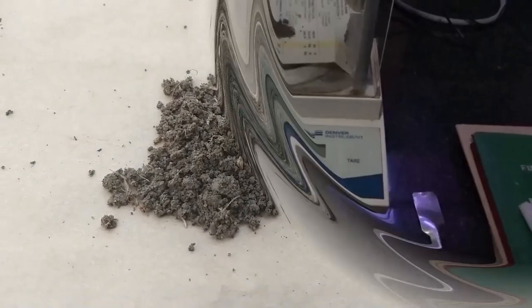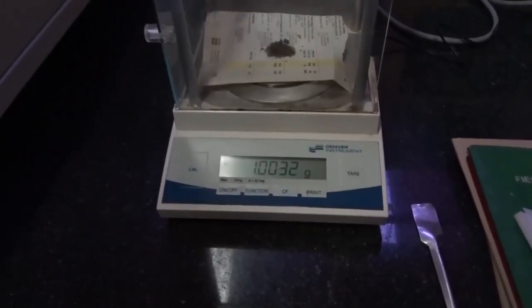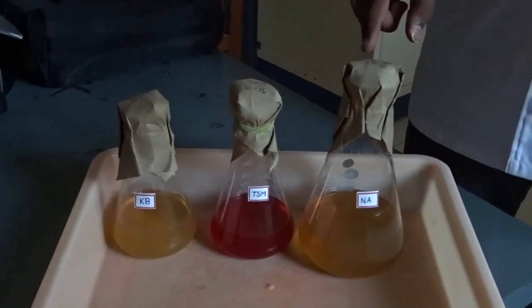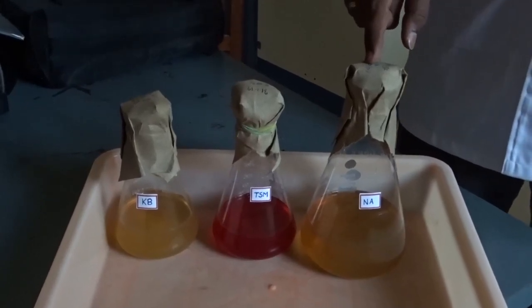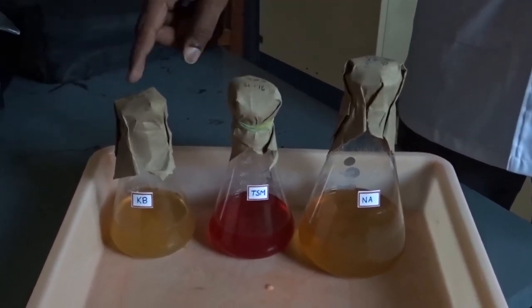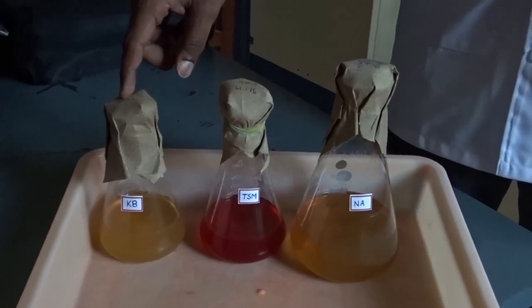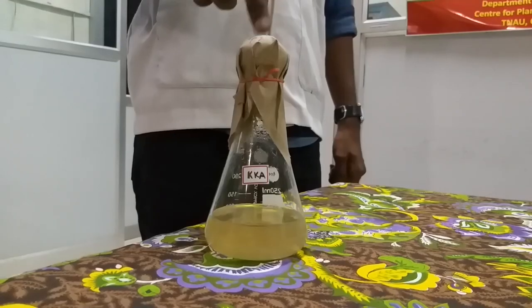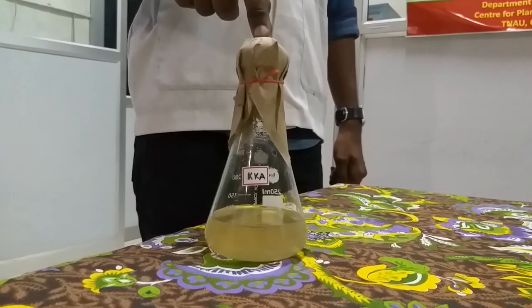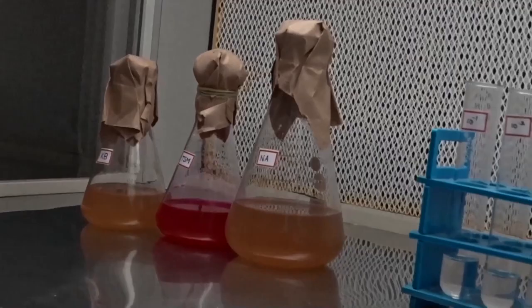Weigh 1 gram of soil sample. Use nutrient agar medium for bacteria, Trichoderma selective medium for fungi, Kings B medium for Pseudomonas, and Kenknight's agar medium for actinomycetes.